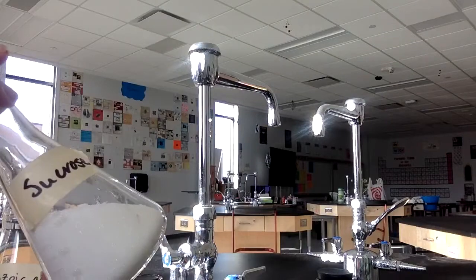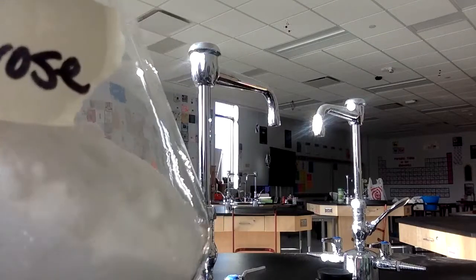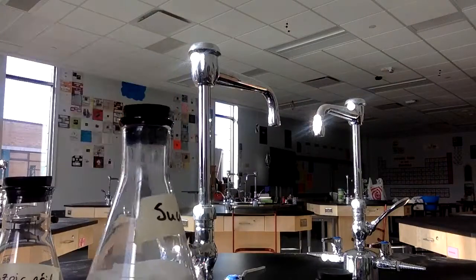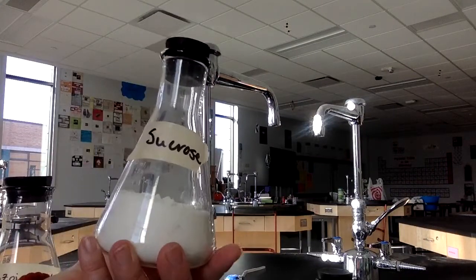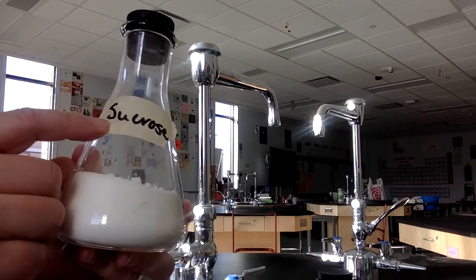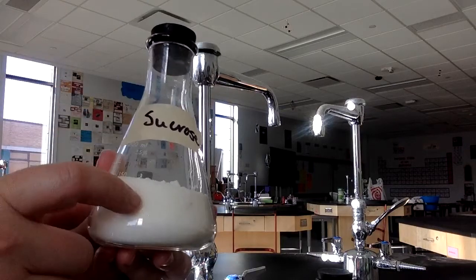Sucrose, the common name is sugar. So it does look like sugar because it is. So kind of white crystals. And in terms of heaviness, it's not super heavy. It's kind of about middle. And then to get the mass, you'll need to add up the elements that make sucrose. It is a 1 mole sample.